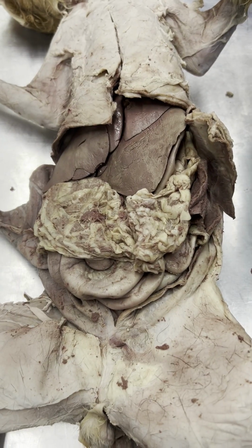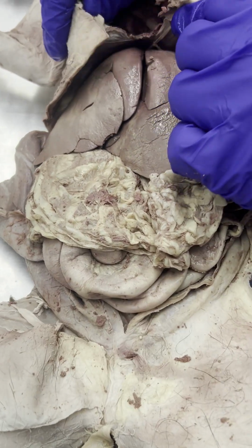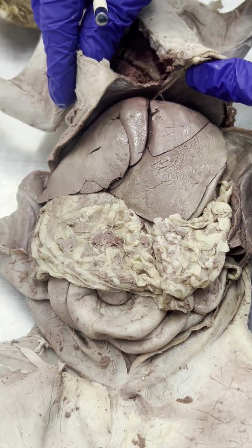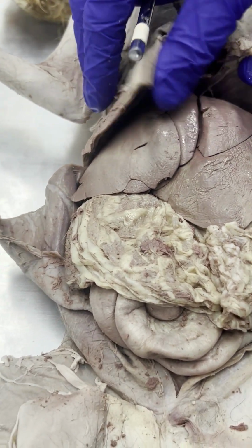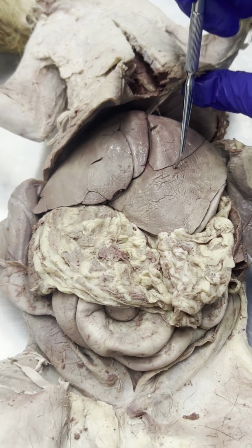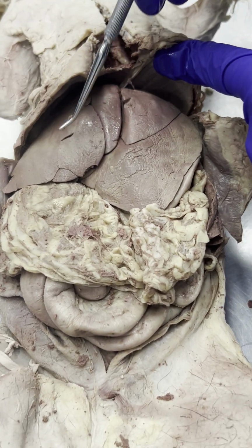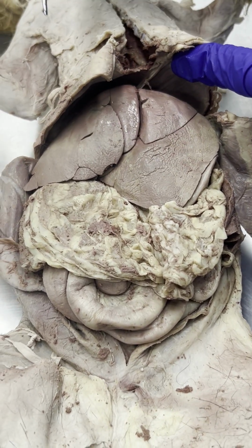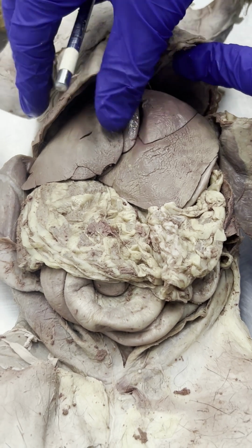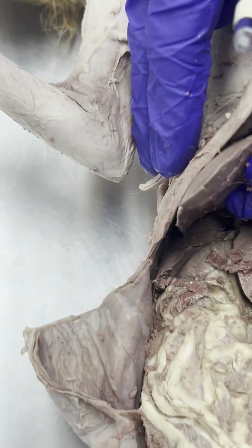Hello, vertebrate anatomists. We are continuing with the cat digestive system today. First thing I want to show you guys is the cat's liver. You might see this and be like, oh, the cat has 4 livers. 1, 2, 3, 4. Well, 4 parts of the liver. 1 liver, but 4 parts of the liver. But in reality, the cat actually has 6 different parts of the liver. There's some hiding under here.